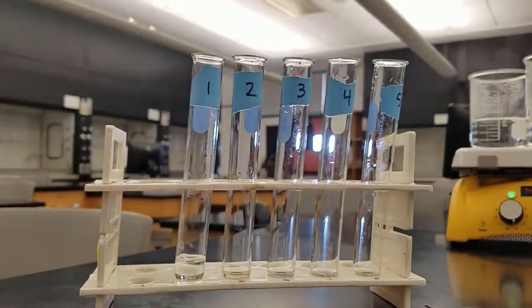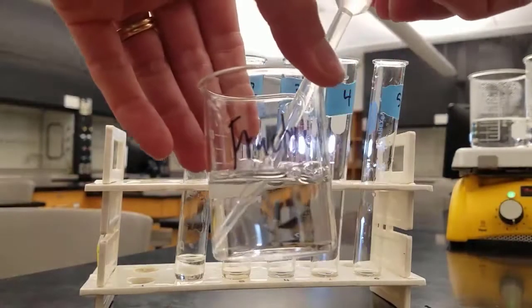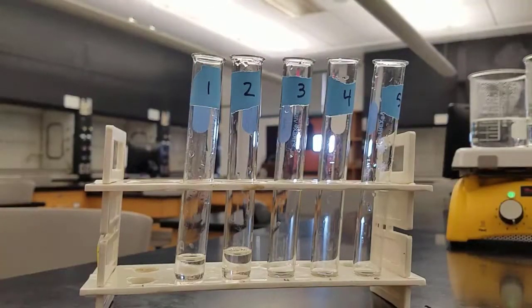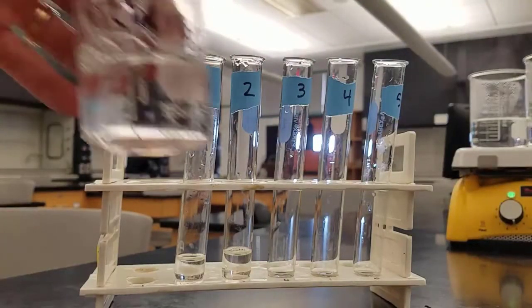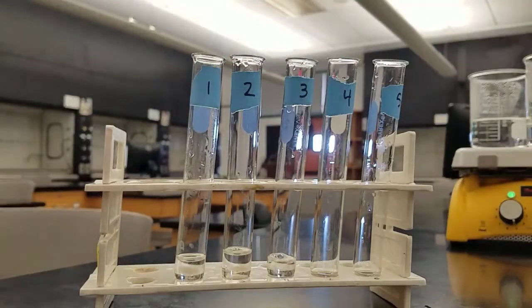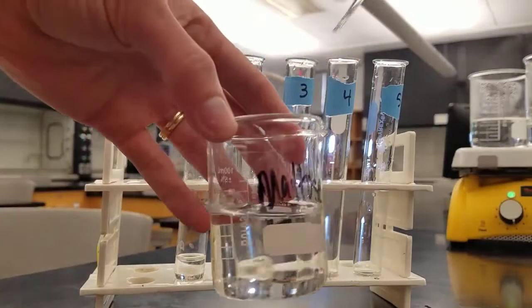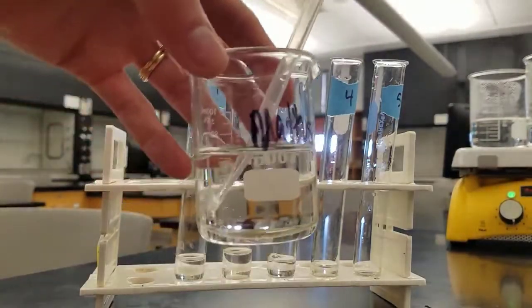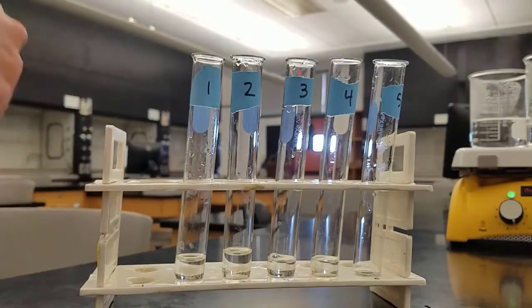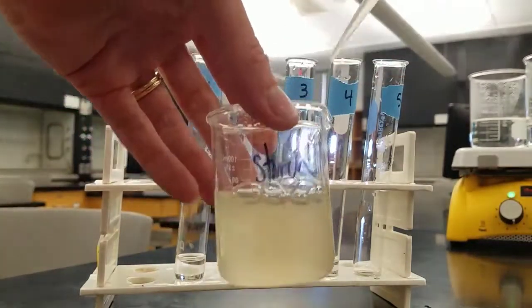On to part D: Barfoed's test for monosaccharides. These are sugars with just one ring. We add the same sugars: glucose in test tube 1, fructose in test tube 2, sucrose in test tube 3, maltose in test tube 4, and the cloudy starch solution in test tube 5.